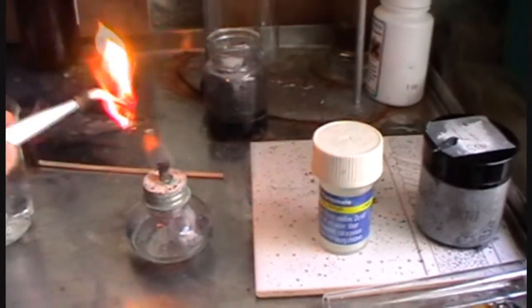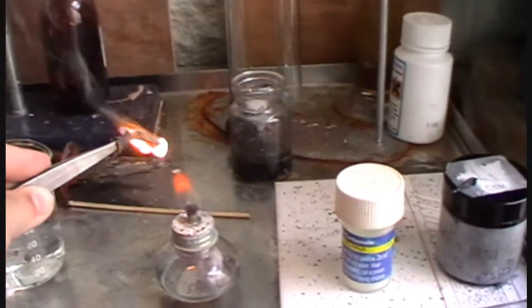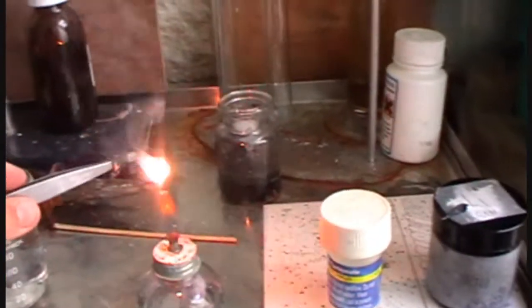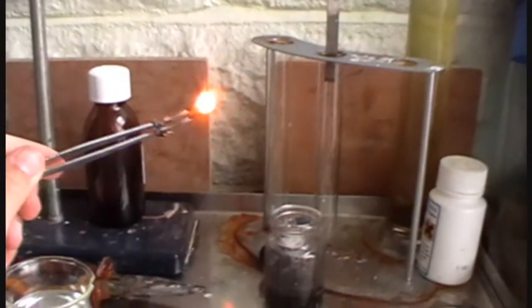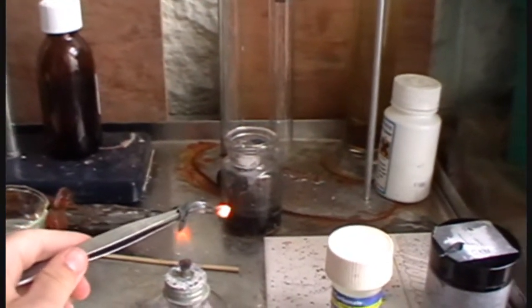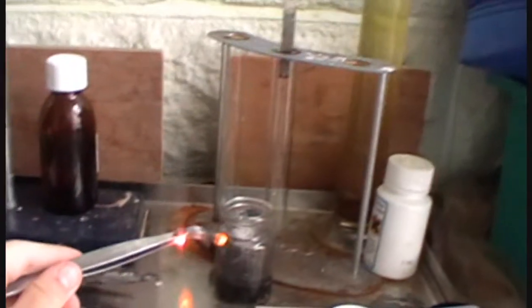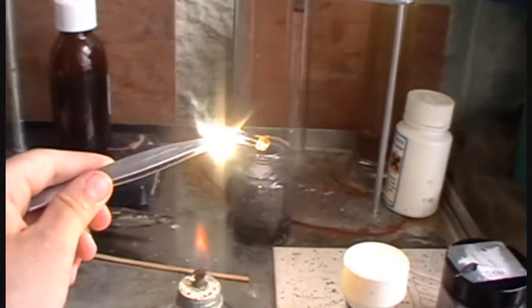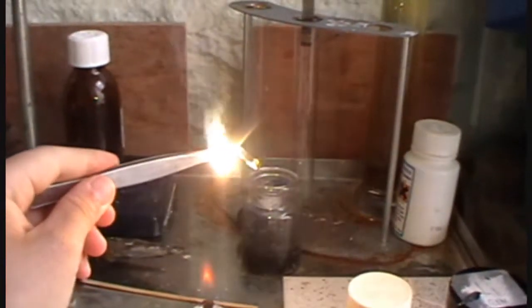We're going to burn our lithium. After the paraffin burns off, the lithium foil will burn. See, it burns quite brightly. Lithium oxide is formed after the reaction.